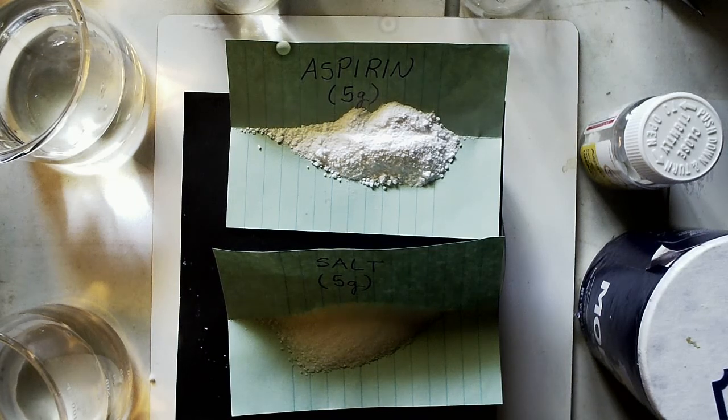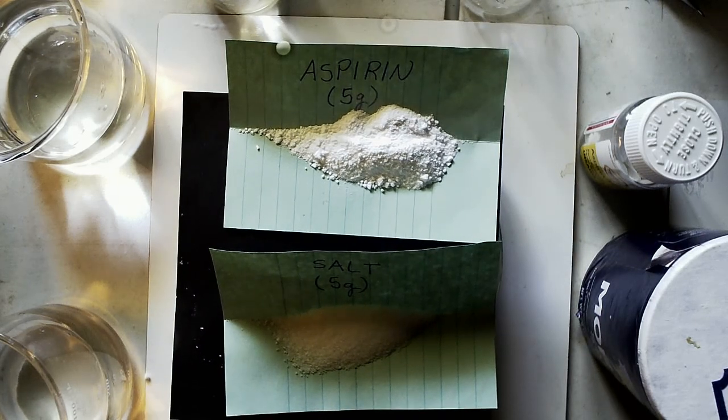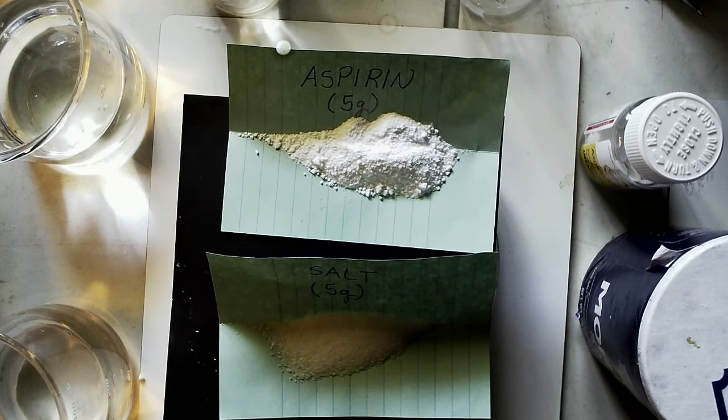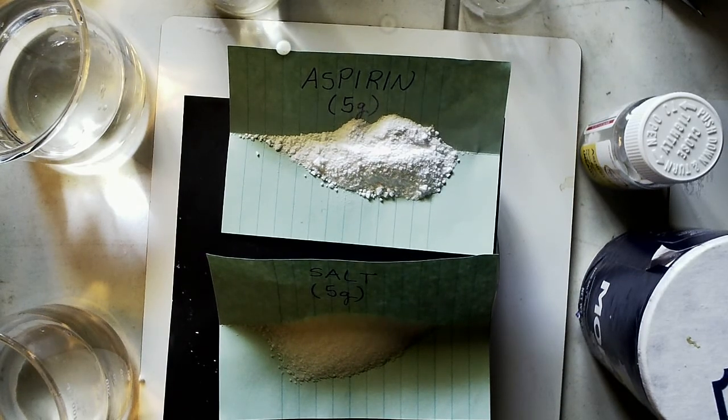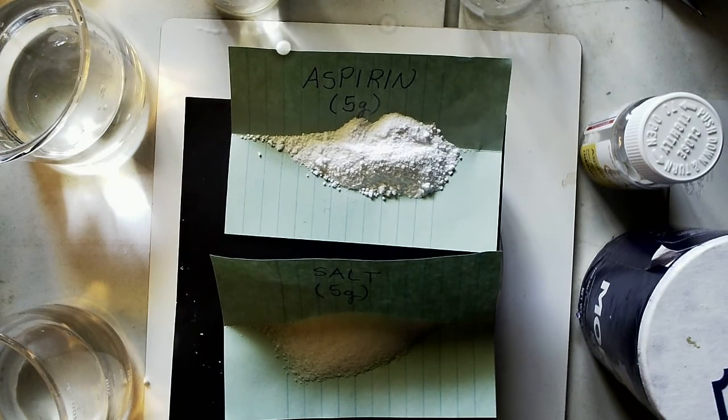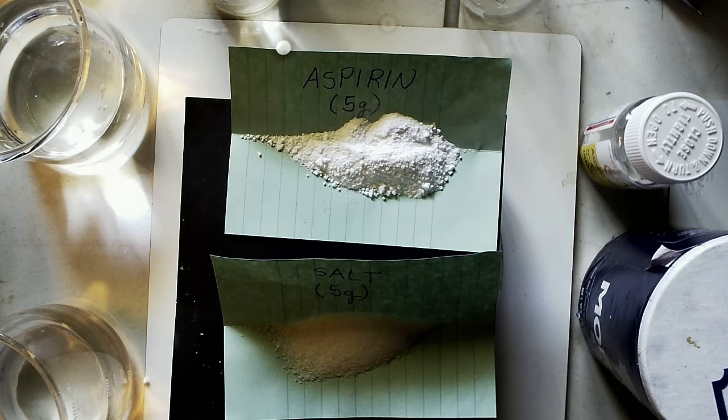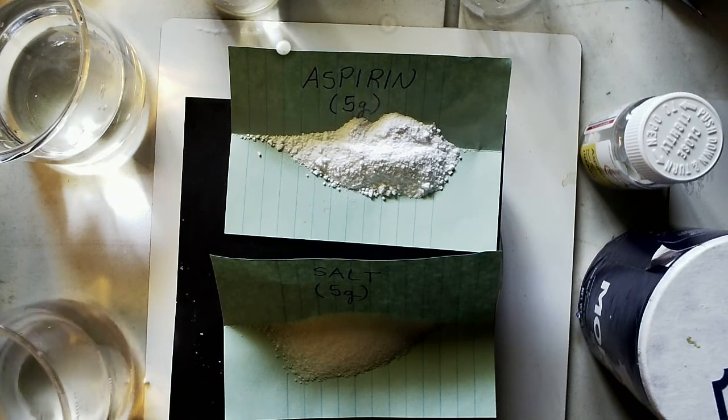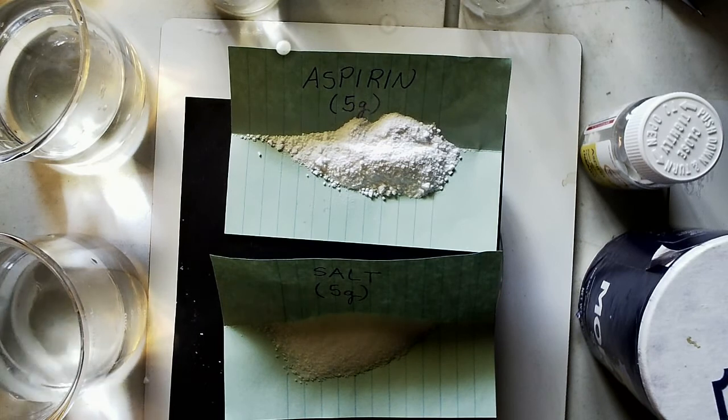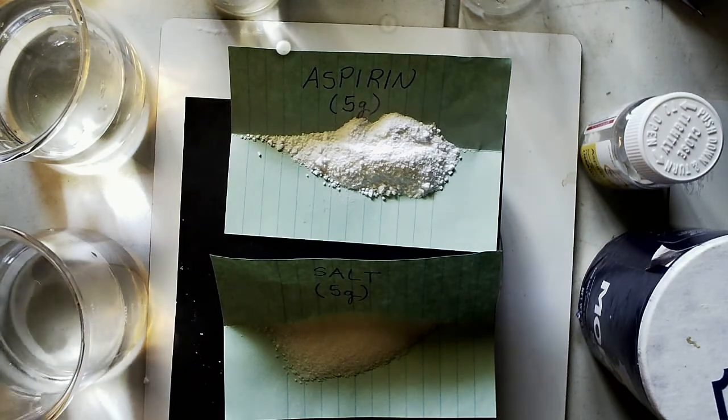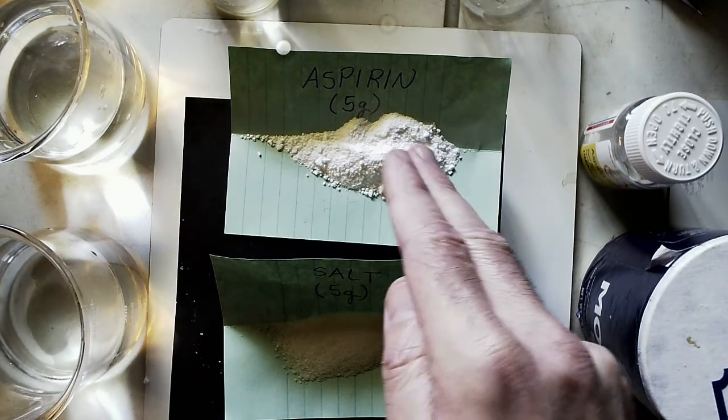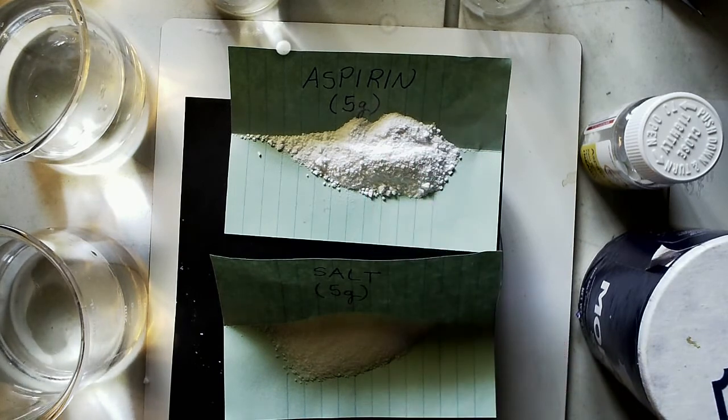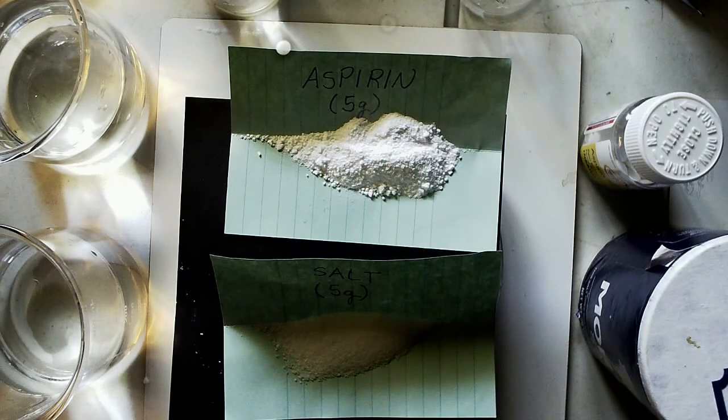You should have taken the notes already on concentration and solubility. This would have been a demo and possibly even a lab we would have done in class, so I just want to go over some examples with you on what the words mean. The first one I'm going to do is I have two beakers here, each one with 200 milliliters of water, and I've got five grams of aspirin and five grams of salt.